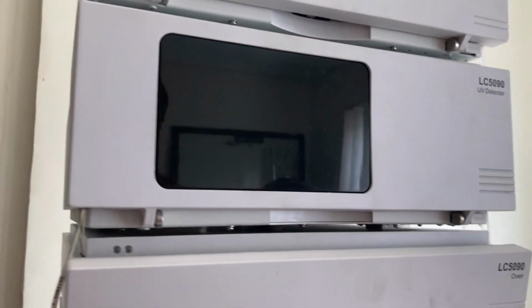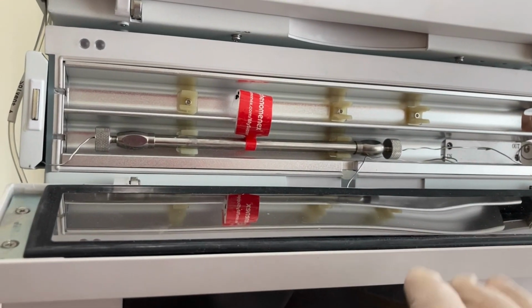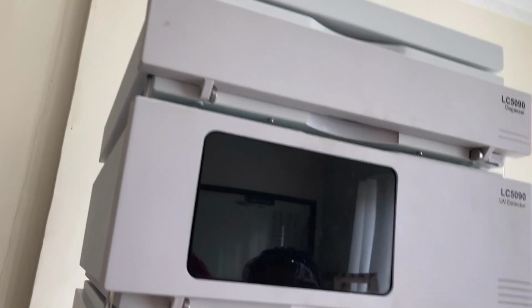It's here somewhere. No, she's all shut down, turned off. Leave that tightened. Leave everything in place. And don't open anything up because air gets inside it. So the tap's shut, everything's closed. And then you can walk away and come back 2 months later and she's all good to go.